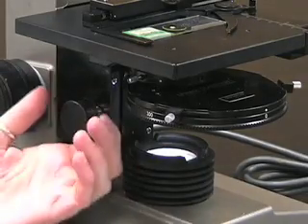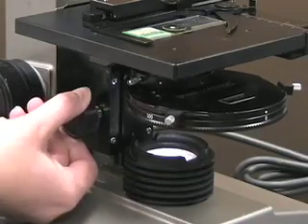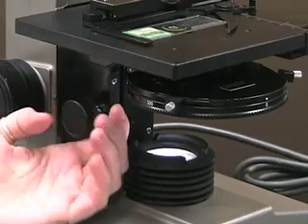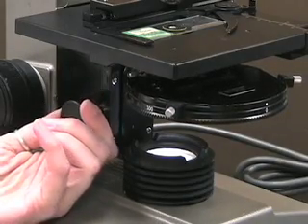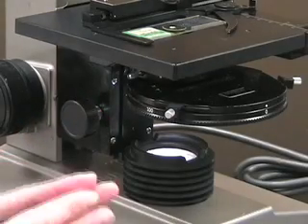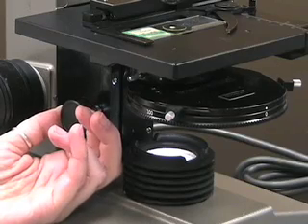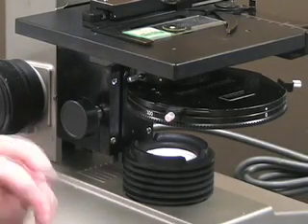After focusing on your sample, the next thing is to adjust your condenser lens. The condenser knob is on the left side of the microscope, in front of the coarse and fine focus knobs. Turn it away from you until the condenser lens is all the way at the top, right up against your slide. Then look through the ocular lenses with both eyes and slowly rotate the knob toward you. This moves the condenser lens down, adjusting how light is focused on your sample. Your image will first become very grainy, then suddenly become very clear — once it's clear, stop and you've set your condenser lens.